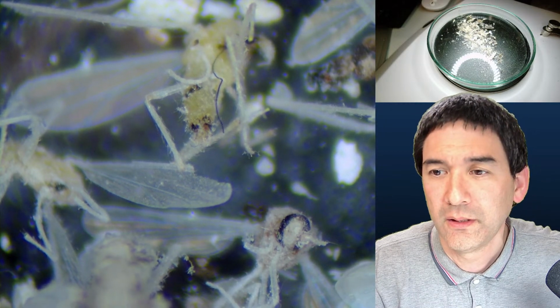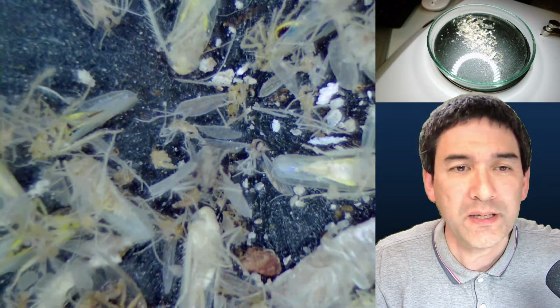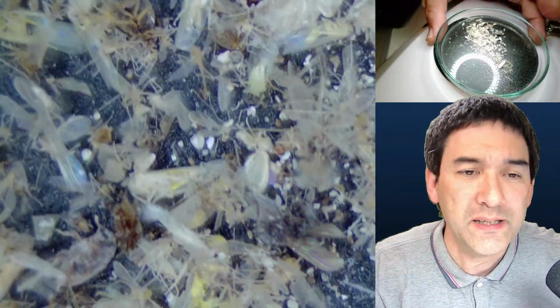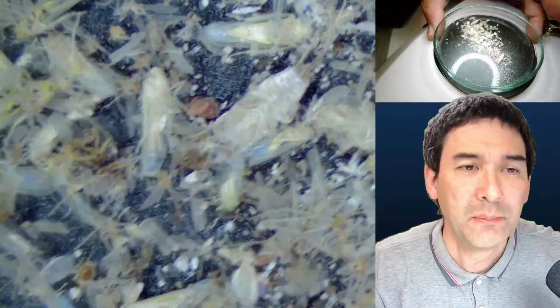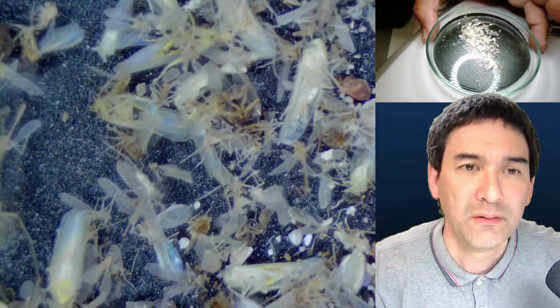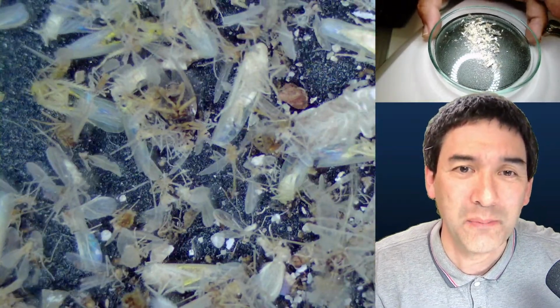Yeah, looks like there are a lot of leaf hoppers in your mix. I think it's a mixed assortment of insects. I did not identify them. And they are extremely brittle. It's not a particularly nice looking sample either, but I just wanted to try this a little bit as a test, as a first test ever since I connected my new camera.